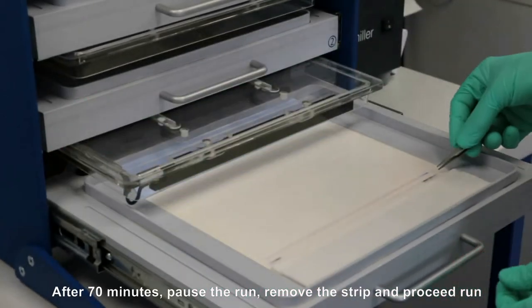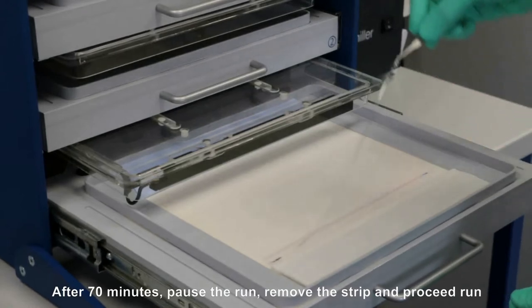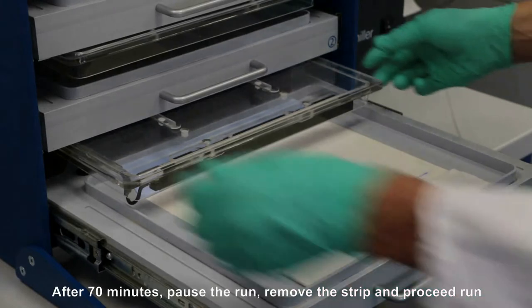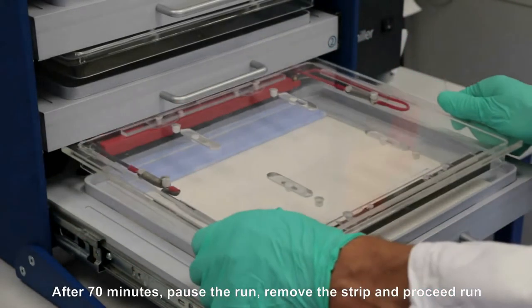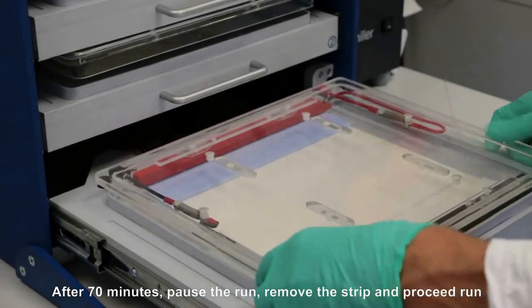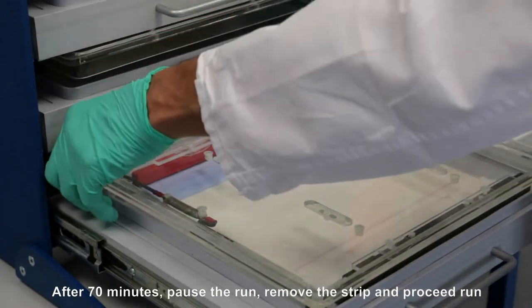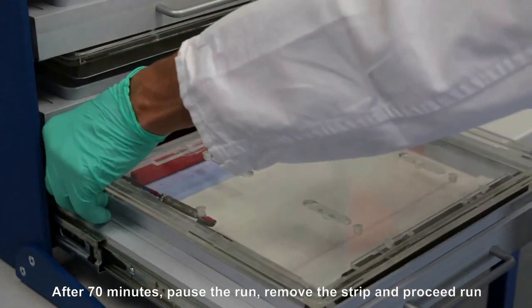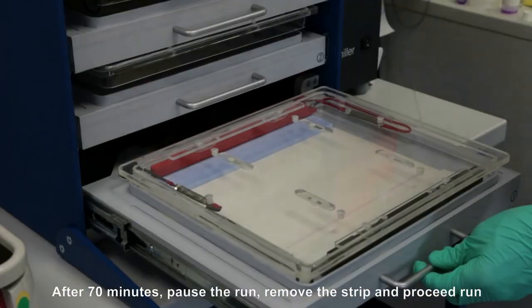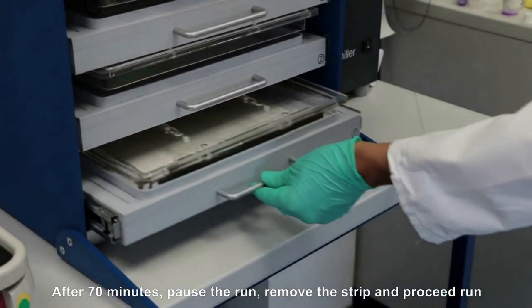Remove the IPG strip and proceed with the run.